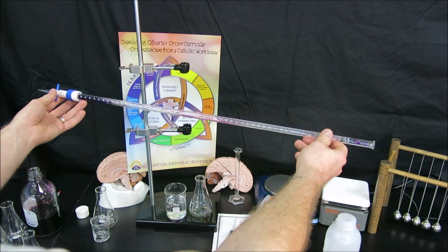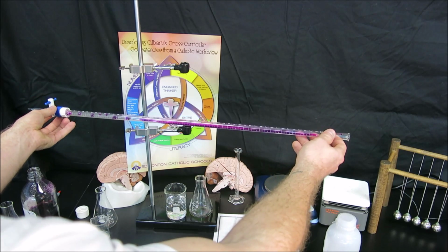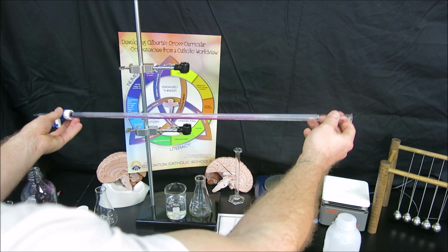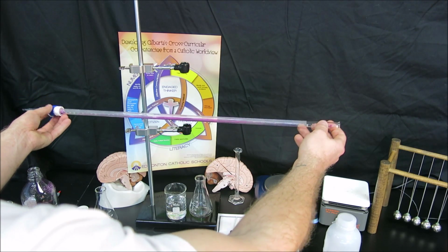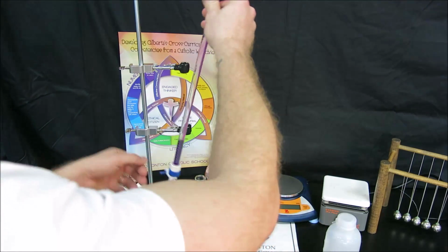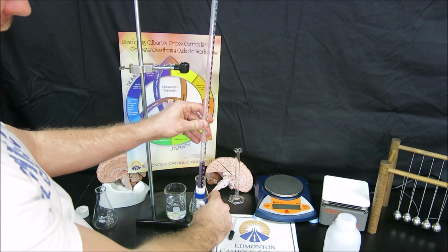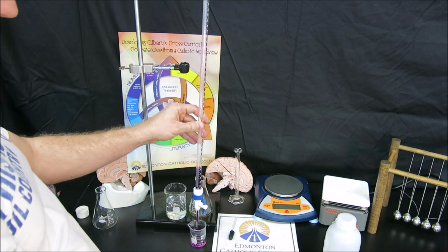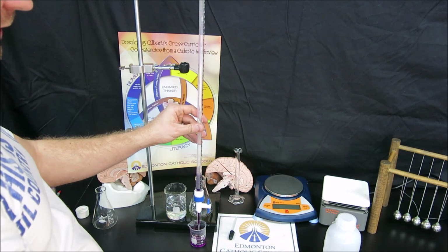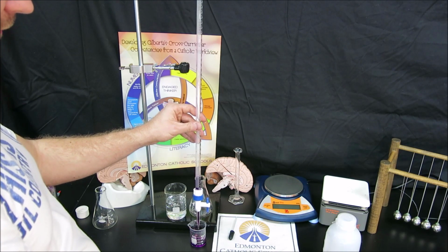So now, same idea. I will tilt that permanganate, again being careful not to lose it out the back end of the burette. And as I tilt, I rotate the burette, rinsing all the sides of the burette along the way. When I'm done, to get rid of that water, I'm going to run my titrant right through the tip as well, and that's going to fill the tip with titrant now instead of with water. So this allows my very first volume addition to be of titrant and not of diluted titrant.